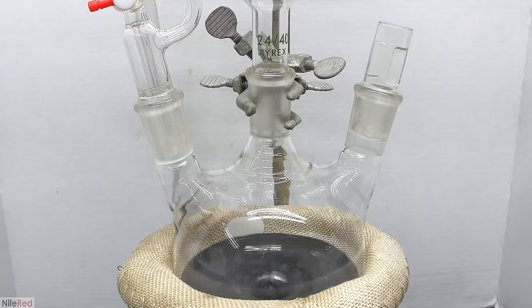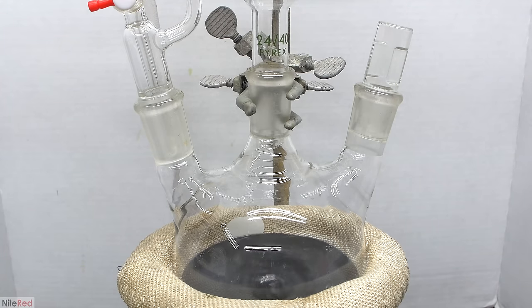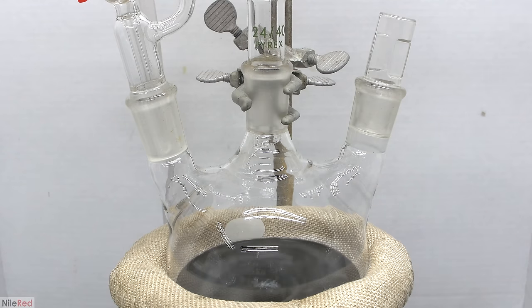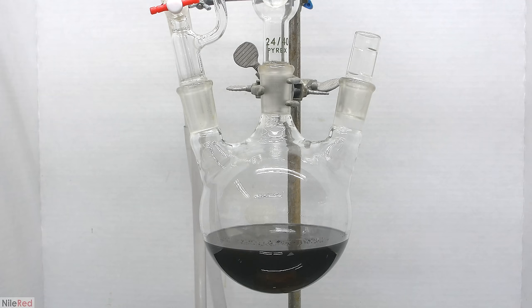The solution turned black as the reaction progressed and the aluminum foil slowly disintegrated. There's still too much aluminum for the stir bar to work properly, but eventually we'll get things stirring. Our endpoint is when we can't visually see any aluminum left. At this point, it doesn't look like much aluminum is left, but time-wise we're only around the 50% mark. The second half was really tedious because I didn't see much happening. Eventually, we reached completion when there was little or no aluminum left. It was pretty late at night, so I took the reaction off heat and continued the next day.